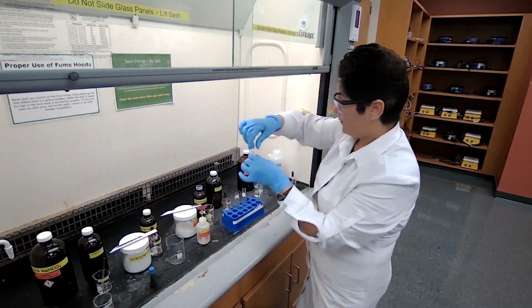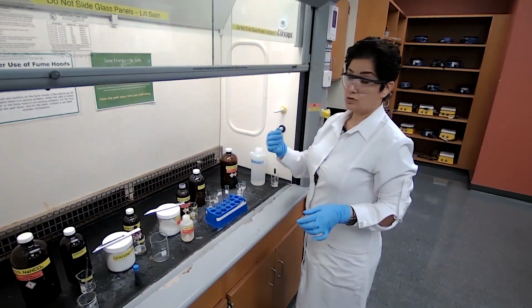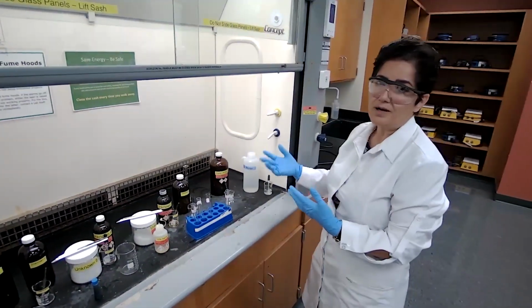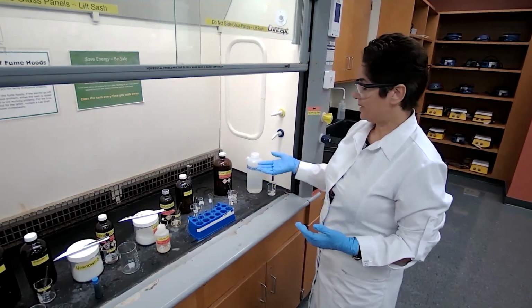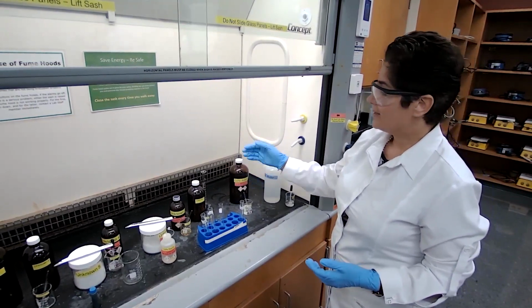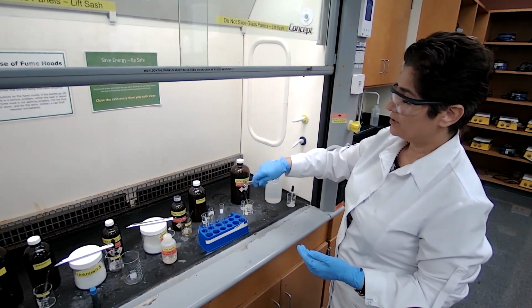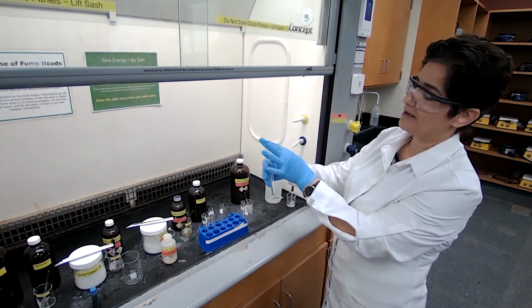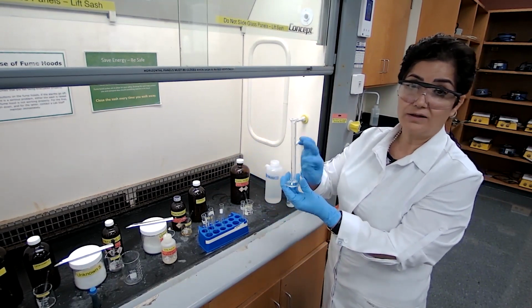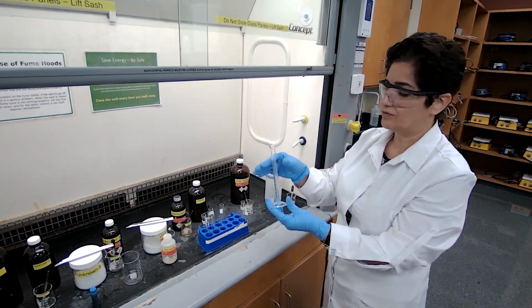Okay. Now, to each of the test tubes, we are adding 40 drops or 2 milliliters. The technique that I showed you to approximate the milliliter is coming in handy now because we are dealing with concentrated sulfuric acid. If you use the graduated cylinder, by the time you transfer to a test tube and return it, you would have some leak of that concentrated sulfuric acid on the graduated cylinder. You touch it, then you touch your skin, you touch your face.